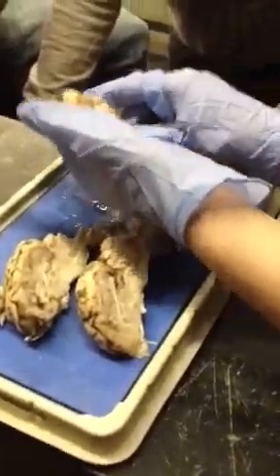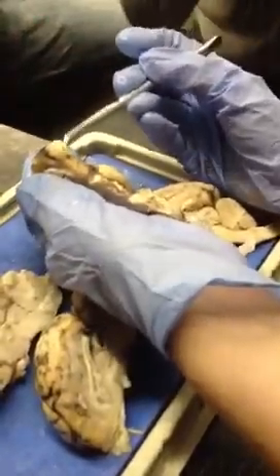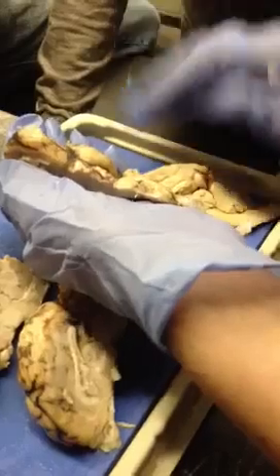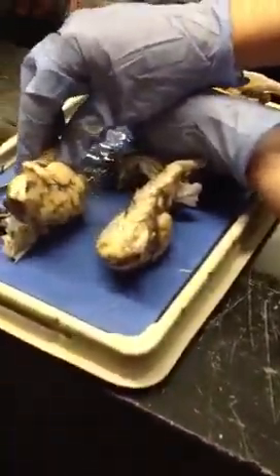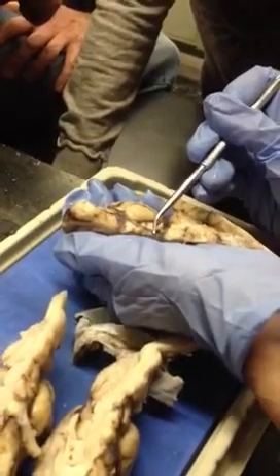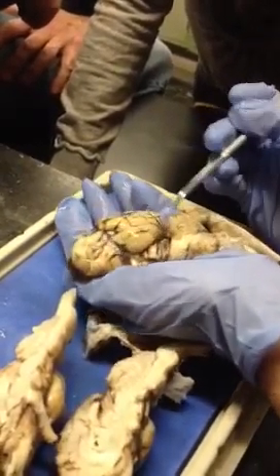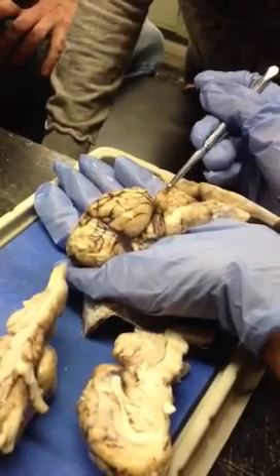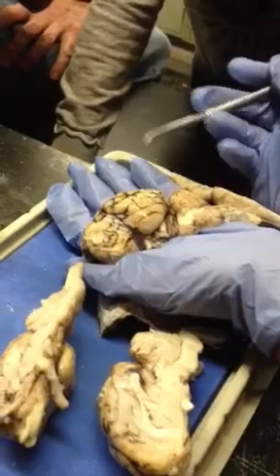So, which is the one that has the trochlear? Yeah. Okay, so cranial nerves. This is one, olfactory bulb. Then two is optic, which you can't really see very well there, but you can on this one. No, not that one. This one. So that's optic. Then oculomotor is here. So that's this flat one right here. Trochlear is the little tiny one right there, which is coming out from in between the cerebellum and the cerebrum.